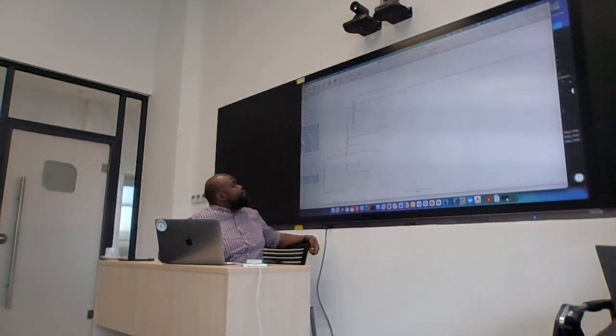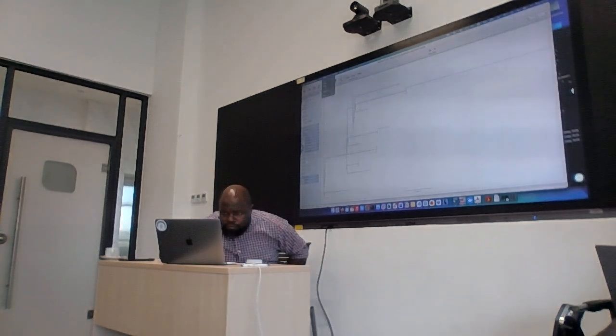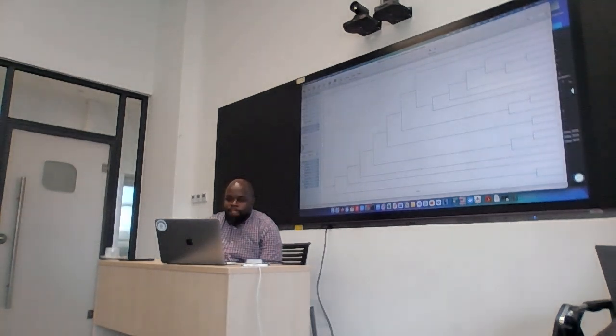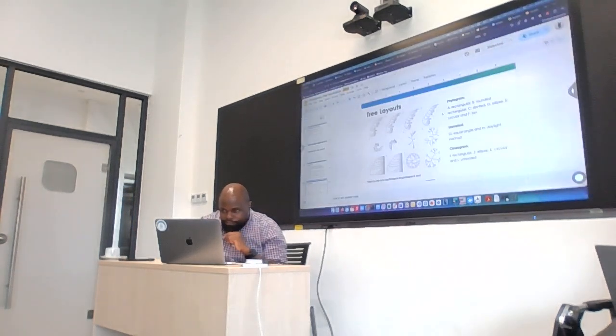So, and I think this should also do the, no, that is only, I thought this also does the cladogram thing. We had a cladogram option. Not seeing it now. Okay. We can also do cladogram here. See? So that option is available. So, I'll go back to my slides.